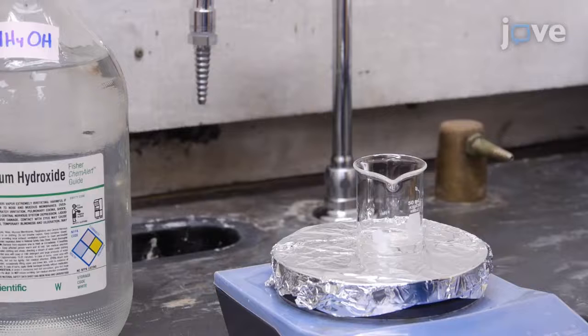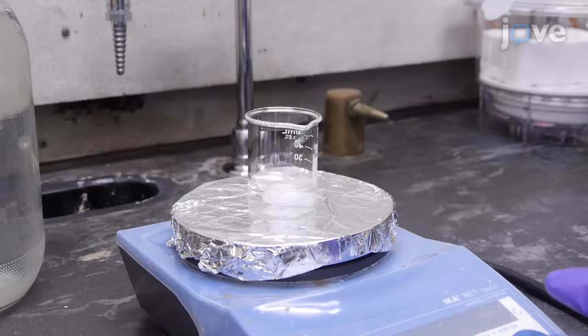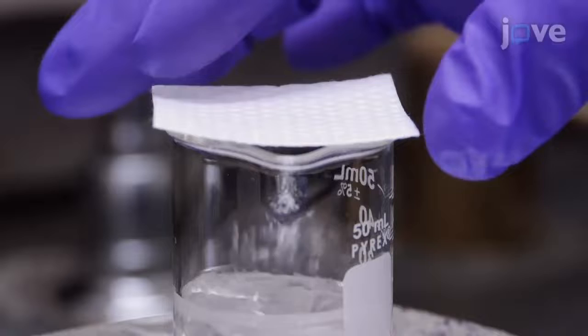In a fume hood, transfer 15 milliliters of a 7.2 molar ammonium hydroxide solution to a 50-milliliter glass beaker. Begin stirring at 500 rpm at room temperature. Add the cerium-3 nitrate and polyacrylic acid mixture dropwise. Cover the beaker with a piece of paper to prevent substantial loss of the solution and let it stir for 24 hours.